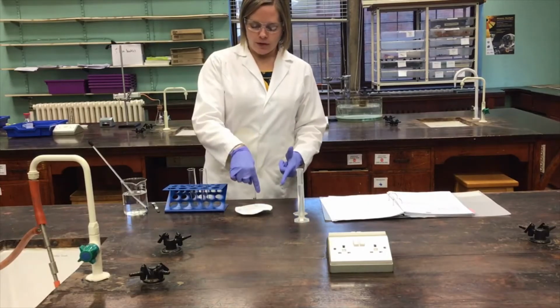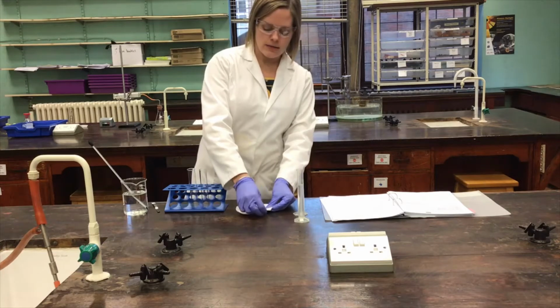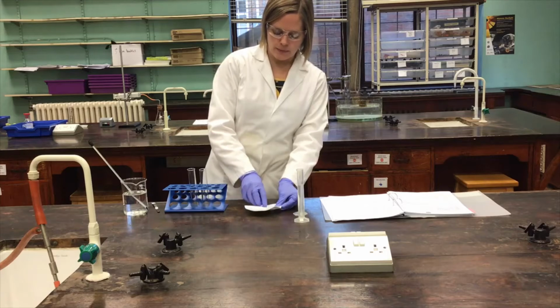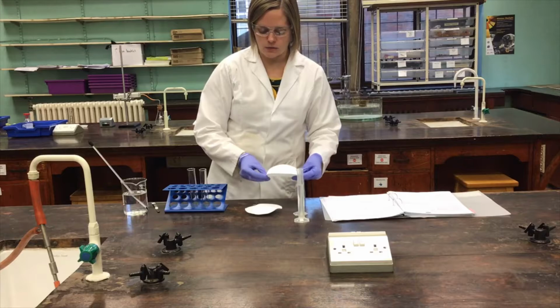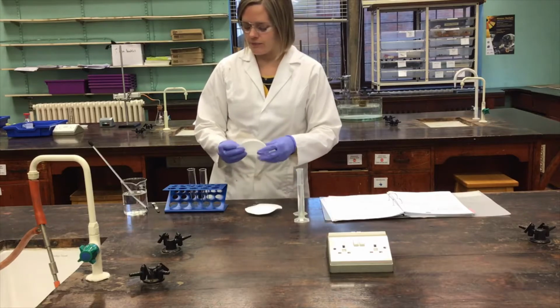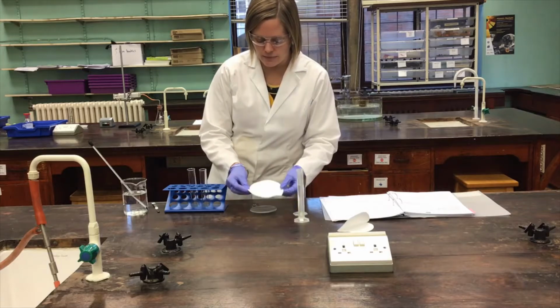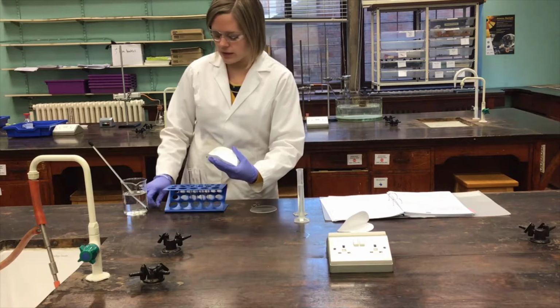Here I've got the crude product from the aspirin preparation. That was experiment A16, so we're on A17 now, and I'm just going to take off the top layer of filter paper like so, and I'm going to try to transfer this crude aspirin into a boiling tube here. It is a bit of an exercise in patience and care, especially since I've got quite a lot of the aspirin in here.